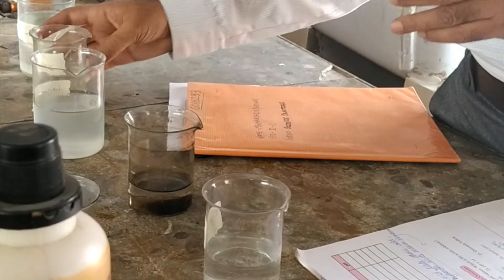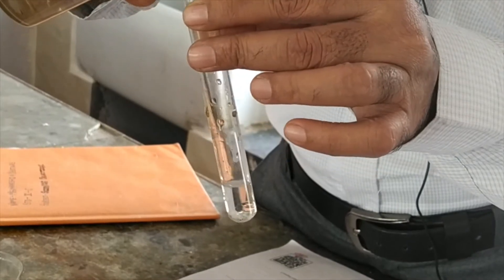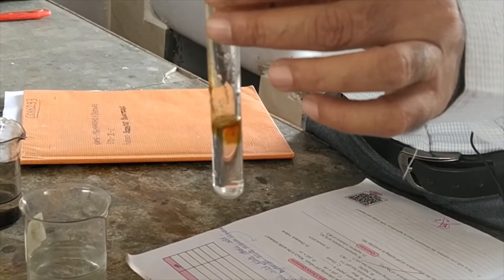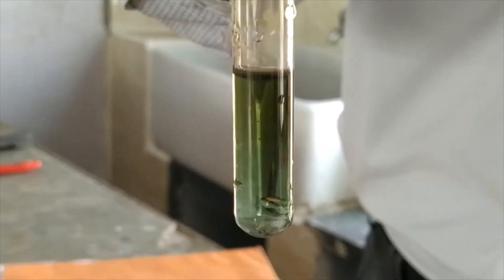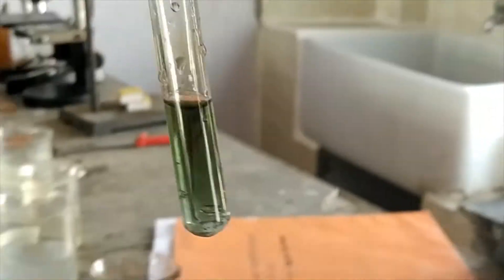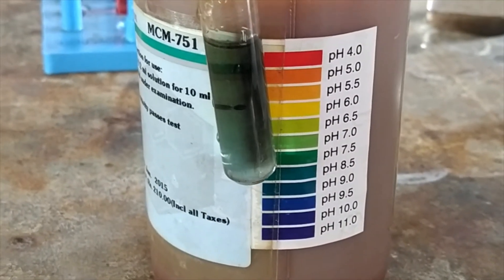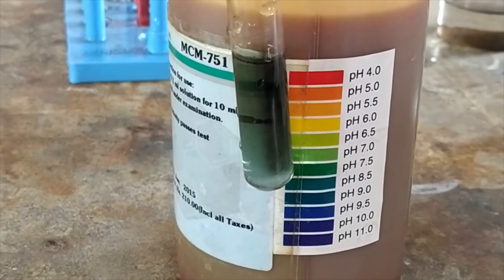Now let us take water. This is pure water, or you can take tap water as well. Again put 2 or 3 drops of universal indicator. See the nice color change — this is green in color. Now let us check the pH. If you see the color change, the pH is 7. So water is neutral — the color is green and the pH is 7.